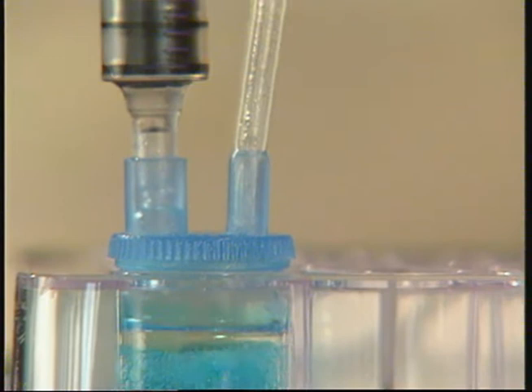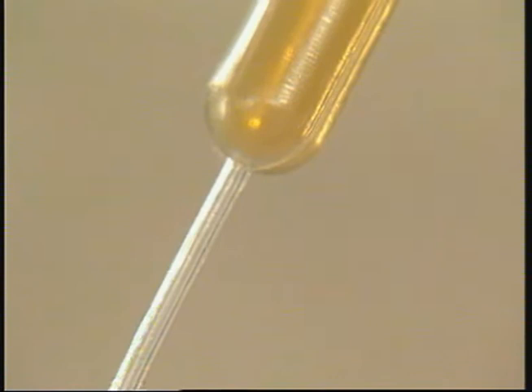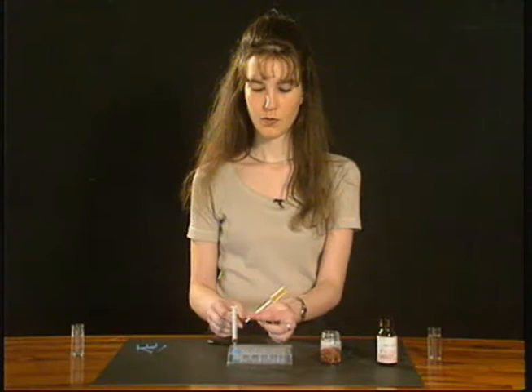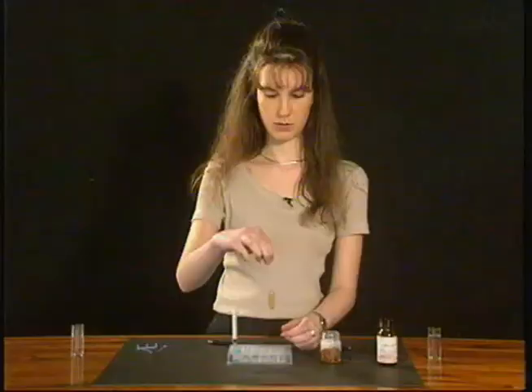Slowly release the pressure on the bulb of the propette and wait till it fills with the brown gas. When the propette bulb has filled with the brown gas, remove the stem of the propette and hold the stem of the propette pinched closed.